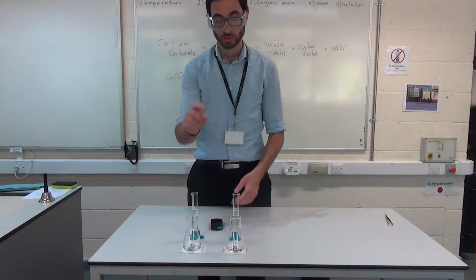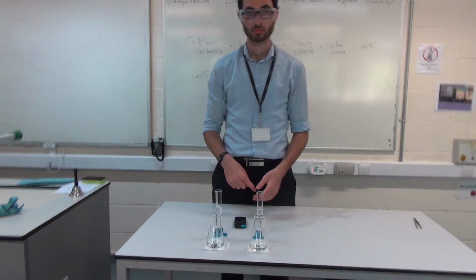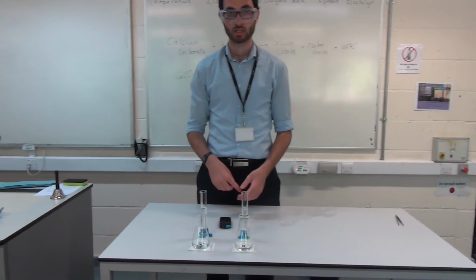Okay? So, sir, do you want to zoom in so that you can see all those? Hold on, I'm twisting it the wrong way.